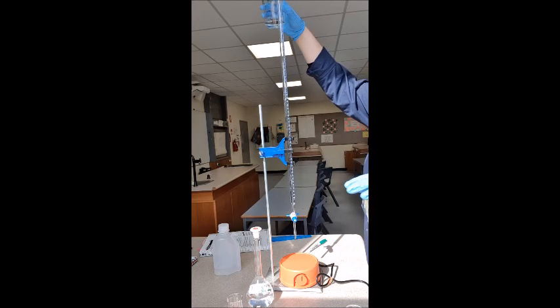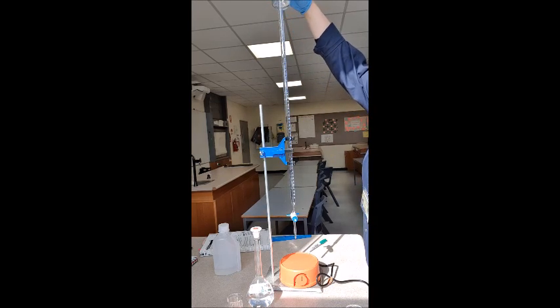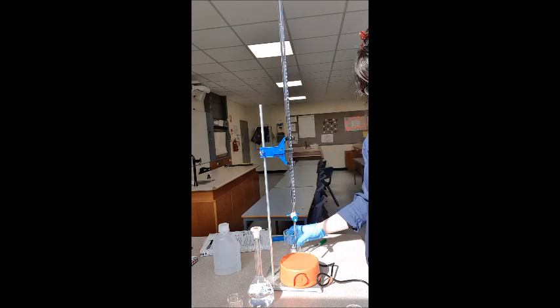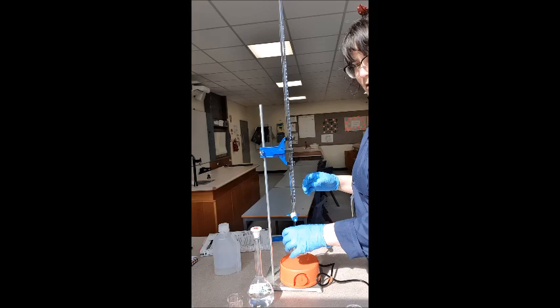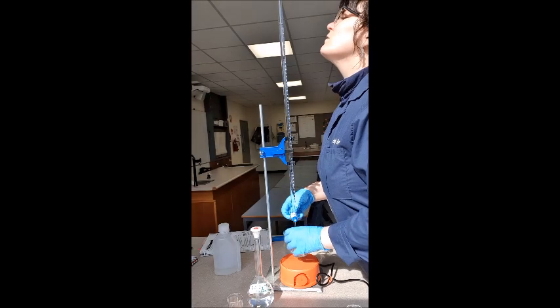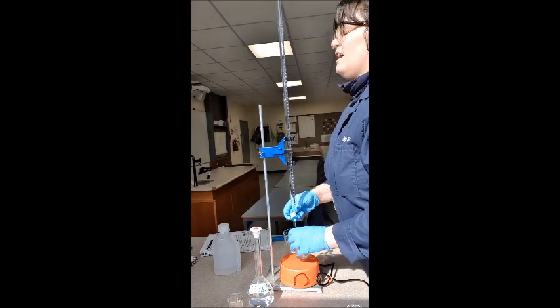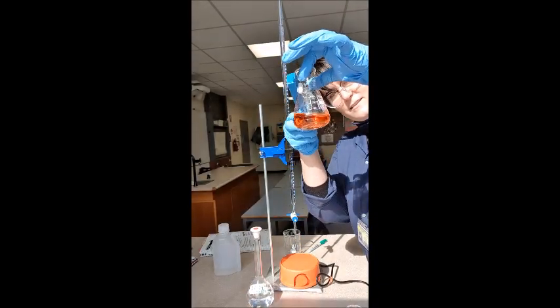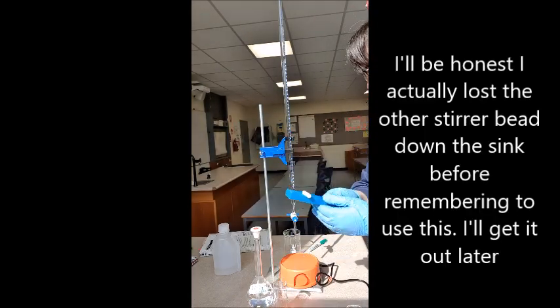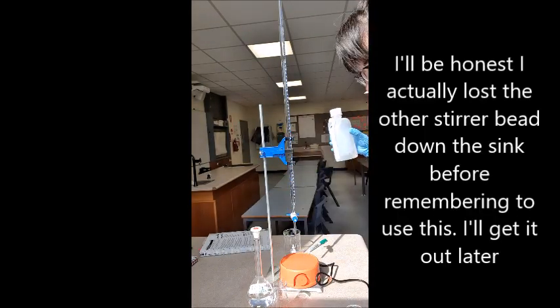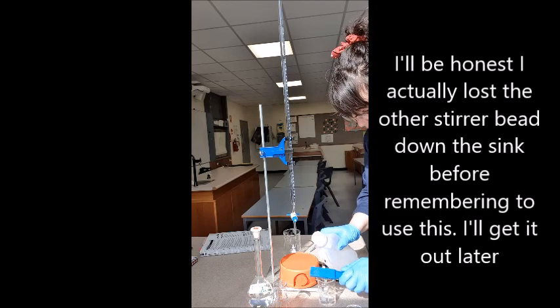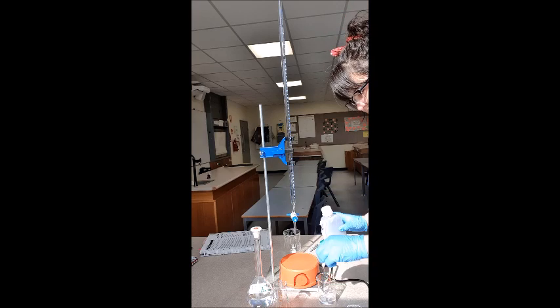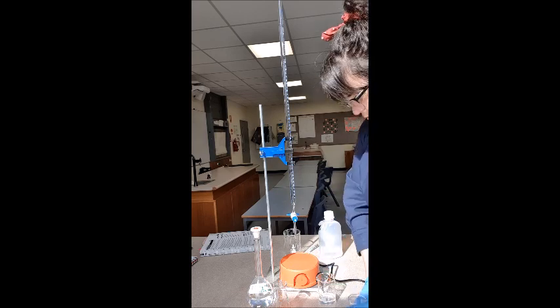So I'm going to fill my burette up again with sodium carbonate. Get it down to zero. And I've got a magnet here to get out the stirrer bead. See that? So I'm just going to give that a rinse into my waste beaker because we don't want to add any acid to our trial.